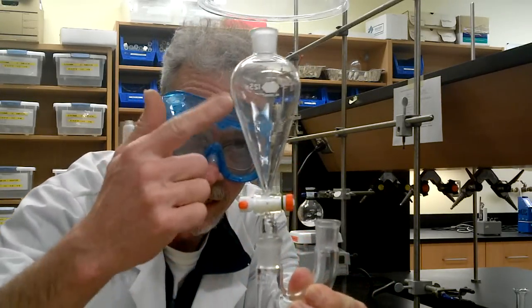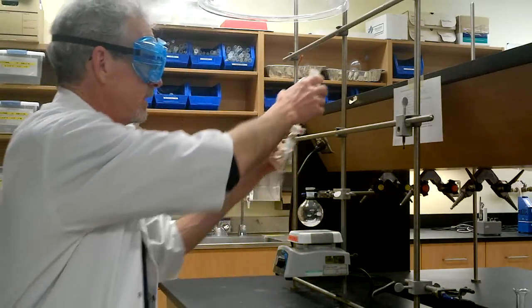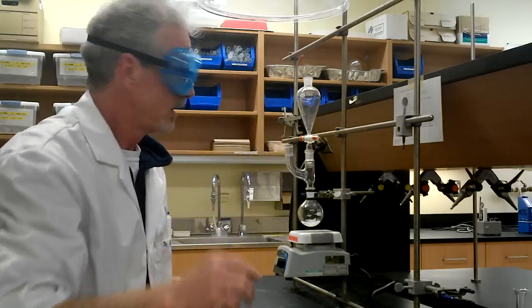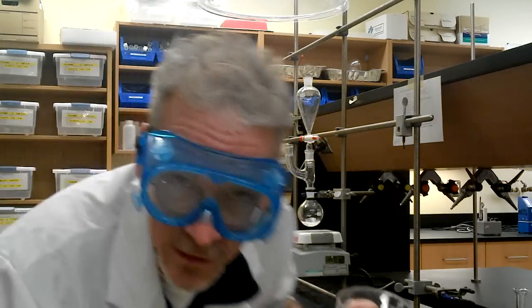So we're going to use the Claisen head and our 125 mL separatory funnel, dropping funnel in place here, and we need to add slowly with cooling, so I've got to go get some ice.